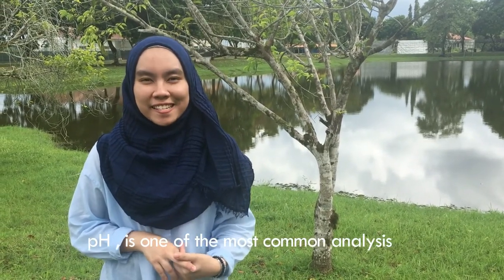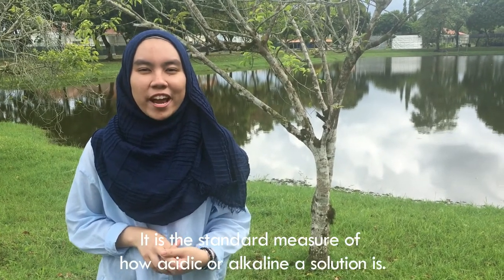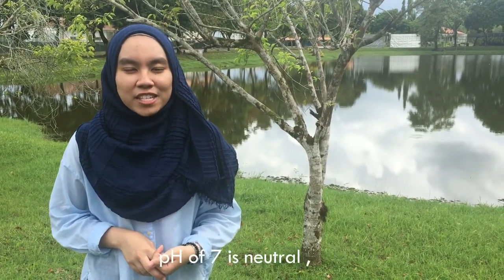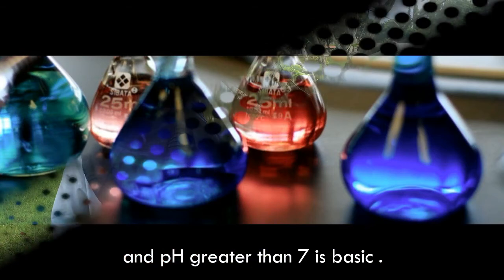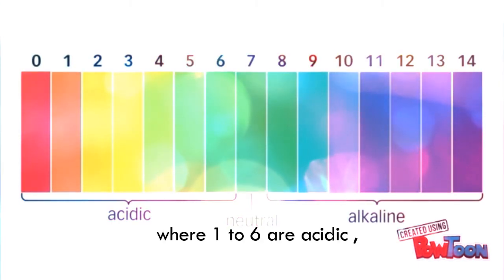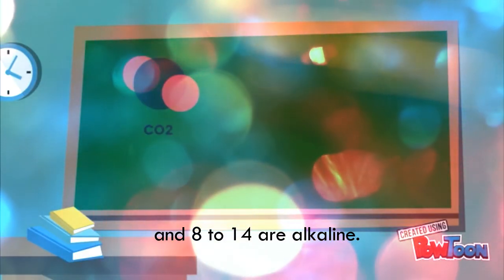pH is one of the most common analyses in soil and water testing. It is the standard measure of how acidic or alkaline a substance is. It is measured on a scale from 0 to 14. A pH of 7 is neutral, pH less than 7 is acidic, and pH greater than 7 is basic. The pH value ranges from 1 to 14, where 1 to 6 are acidic, 7 is neutral, and 8 to 14 are alkaline.